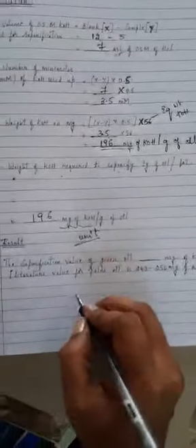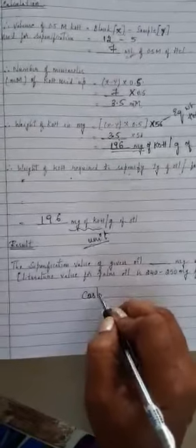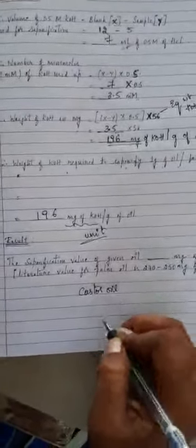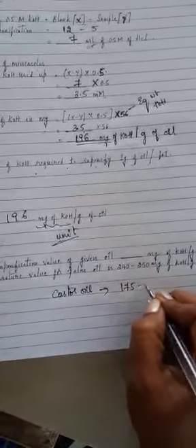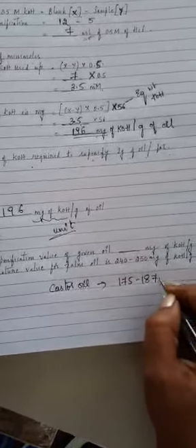So according to that, we have different saponification value ranges, for example castor oil, palm oil, coconut oil. The sample we had taken is castor oil. So the castor oil range is around 175 to 187 milligram.